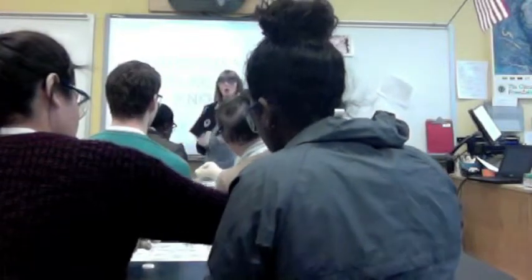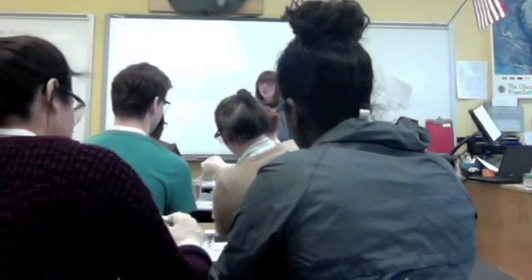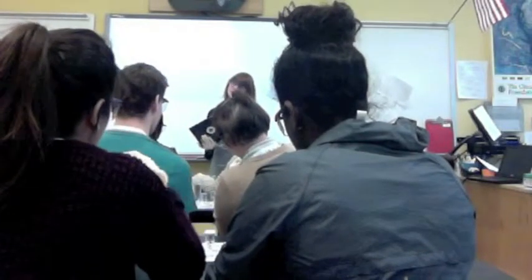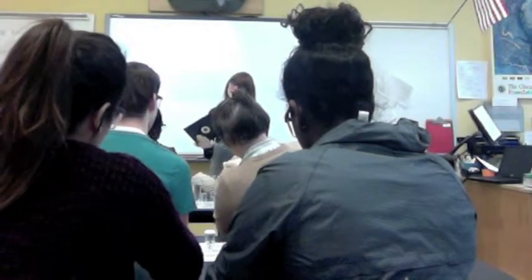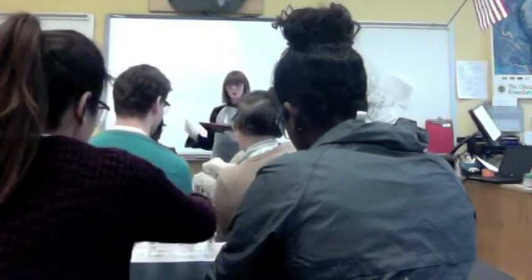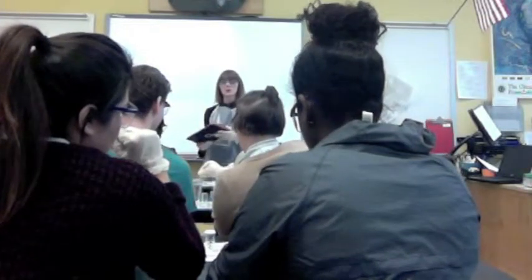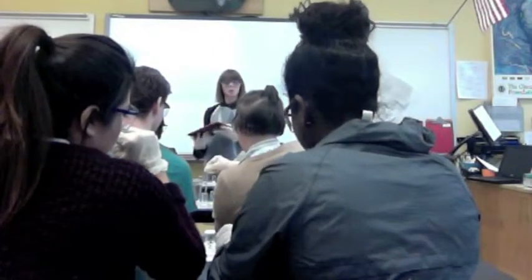While you are filling up your pipettes, I would like you to share a couple of things about what you already know about water quality testing. You use pH. Okay, so pH is something that you might test. Nathan, do you know much about what pH is? It ranges to how basic or acidic a liquid is. Okay, how basic or acidic a liquid is. What are some other data points that we might want to collect for testing our drinking water?